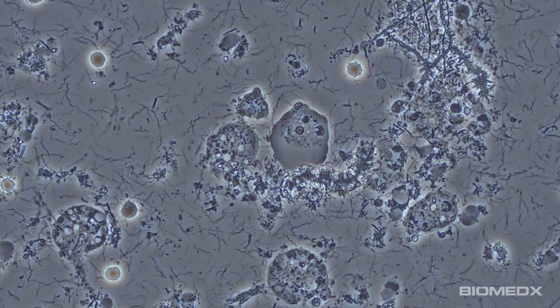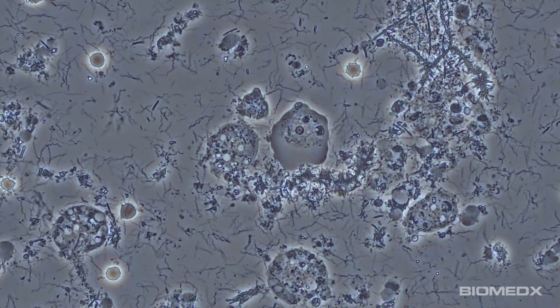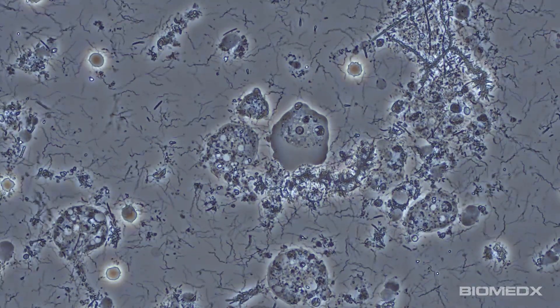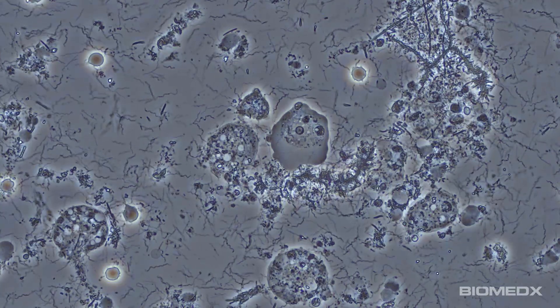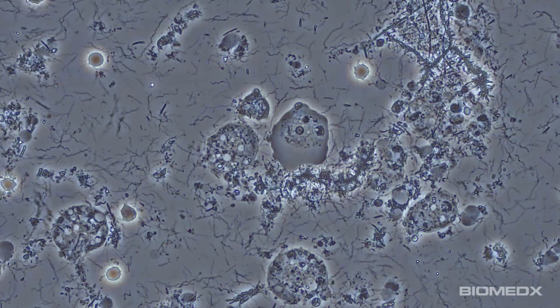What we are looking at here is a great example of what people can have lurking in their mouths that can negatively impact health. Oral spirochetes have been implicated in diabetes, Alzheimer's, and cardiovascular disease, to name a few issues.